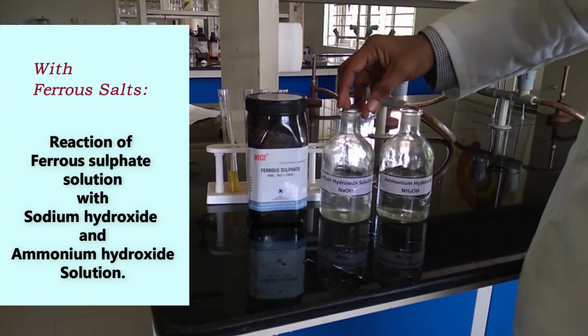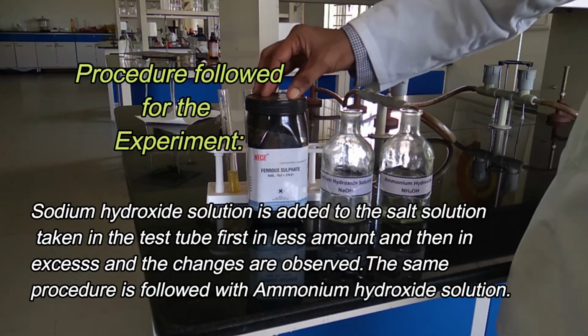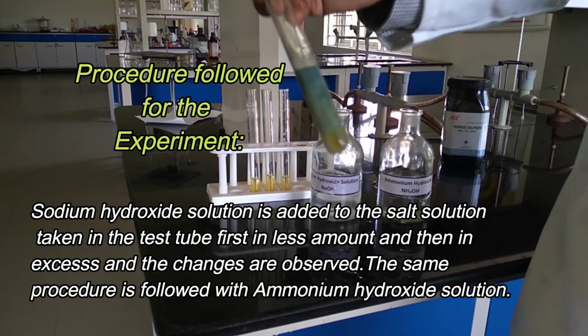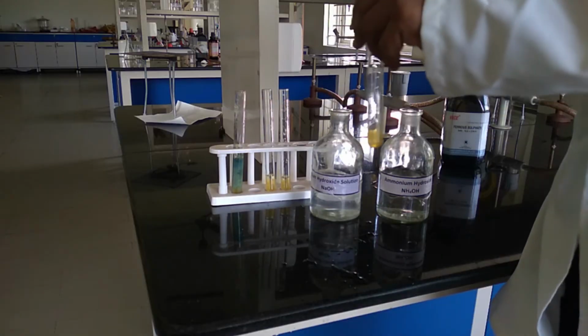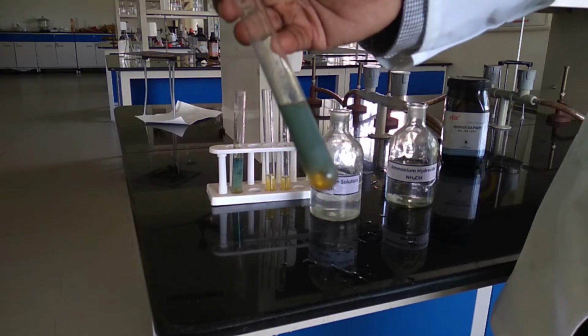See the effect of sodium hydroxide and ammonium hydroxide on ferrous salts, ferrous sulfate solution. When you add sodium hydroxide into it, it forms a dirty green precipitate of ferrous hydroxide. When we add ammonium hydroxide into the ferrous salts, it also forms a dirty green color precipitate of ferrous hydroxide.